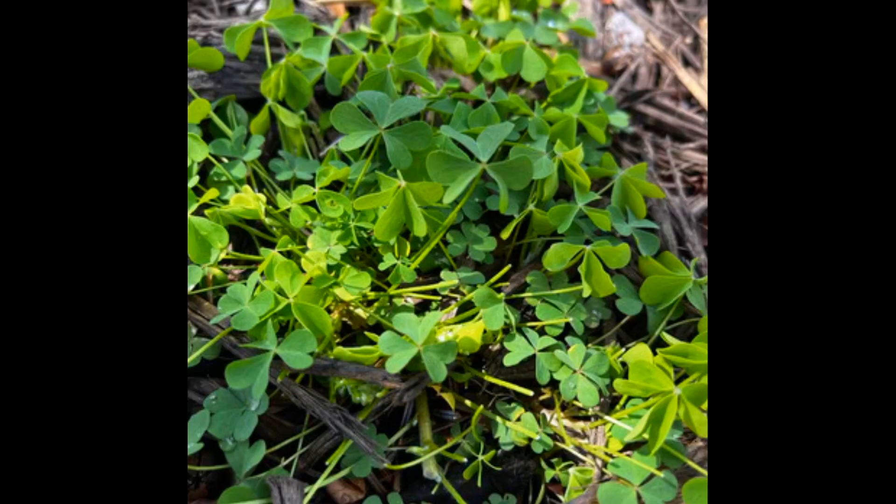It is March and all around me things are starting to emerge from the ground after the cold winter season. It's also the month for St. Patrick's Day and four-leaf clovers. All of these things make me think of the color green and how we can learn more about it under a Foldscope. Let's take a closer look at what makes something green.